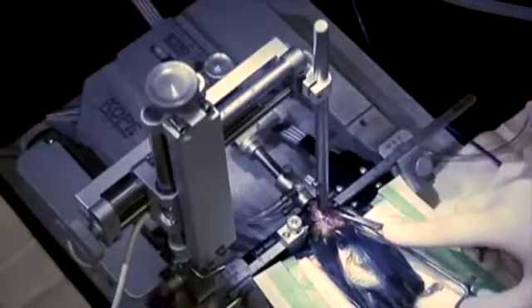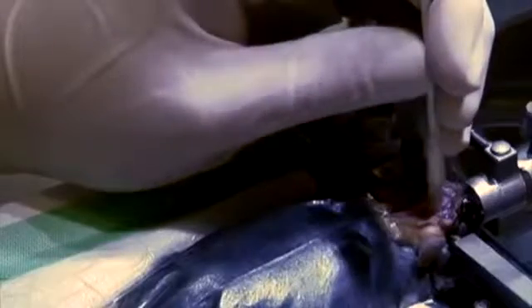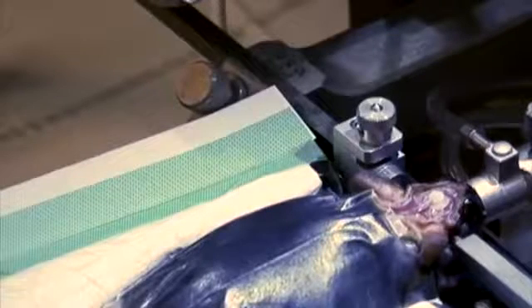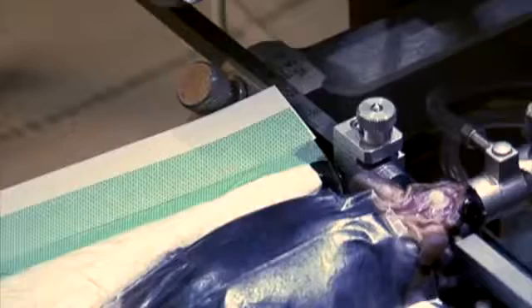Next, hold the cannula in place with the curved hemostat while raising the driver. Slowly release the hemostat to ensure that the cannula is properly secured to the skull. Use a cotton swab to press down on the top of the cannula. Fit the sterile rat bone clippers into the groove between the top and base of the cannula, and with the clippers level to avoid detaching the cannula from the skull, clip off the top of the cannula while still pressing down with the cotton swab.